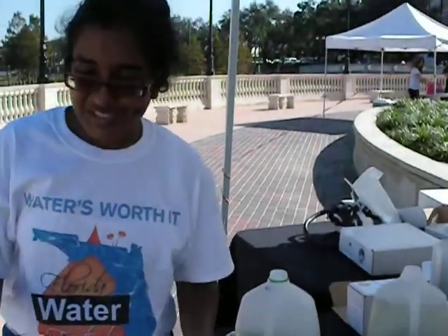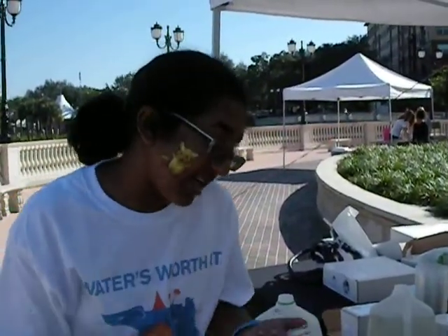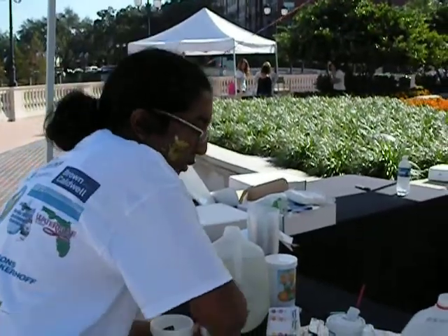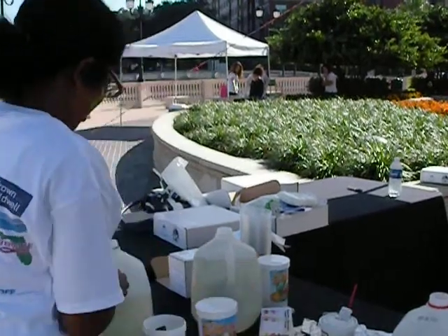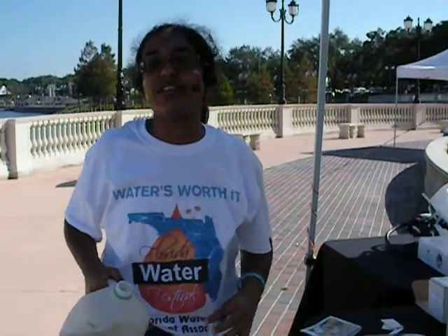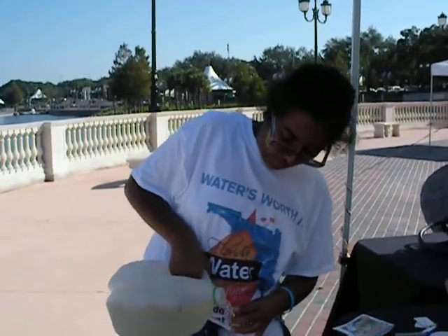I'm just showing people how to test water quality. We're not doing the turbidity test because this water is pretty clear. So what we're going to do is take our lake water, which we collected earlier, and put it into this container. We filled about 8 milliliters of water.